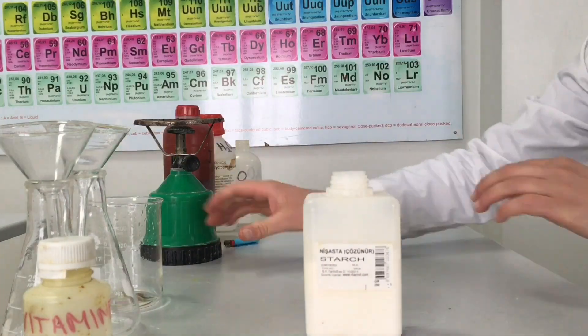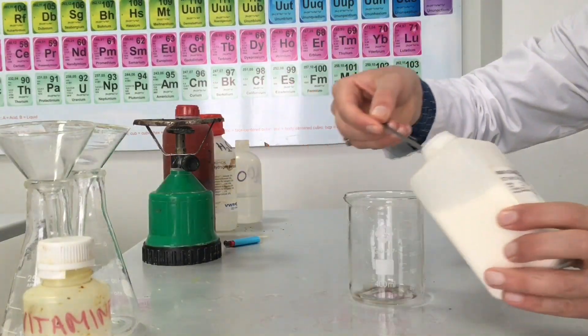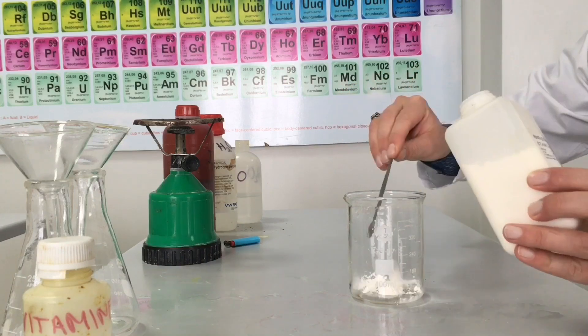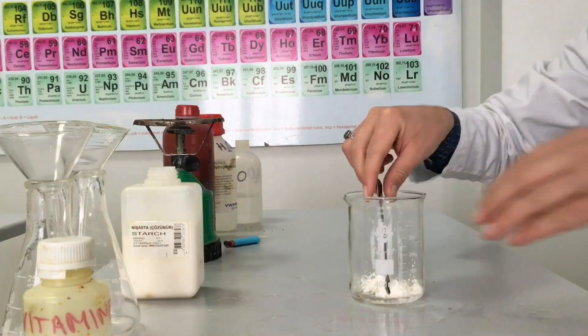We are presenting you iodine clock reaction. First we prepare starch solution.